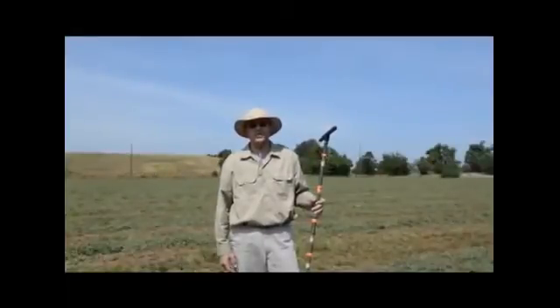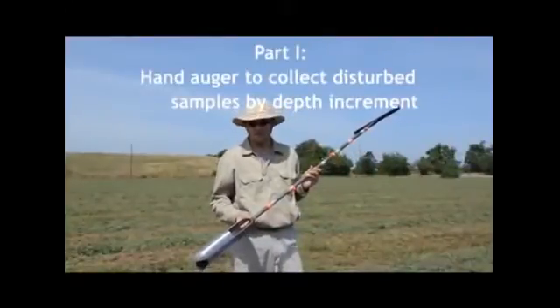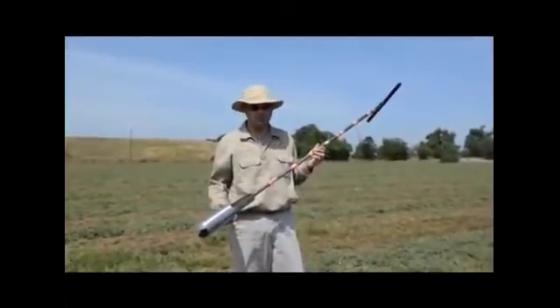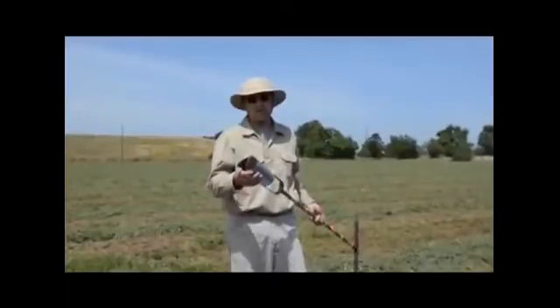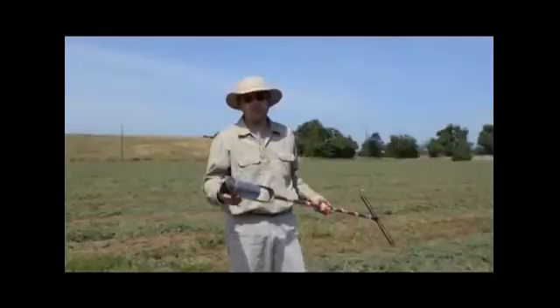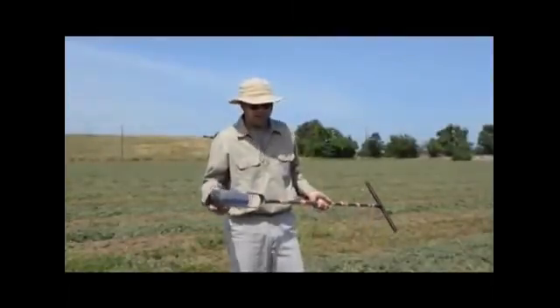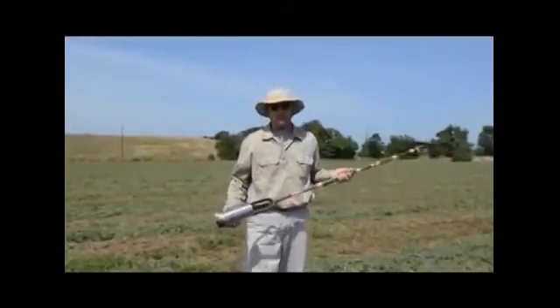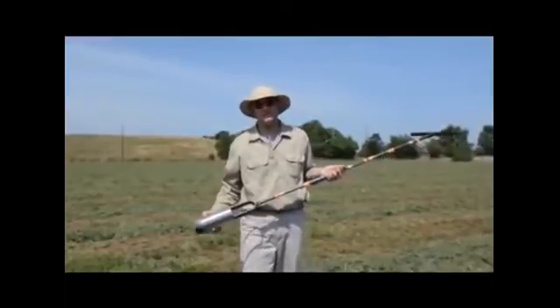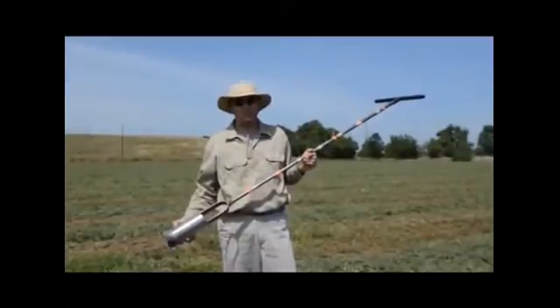such as soil texture. And this is a stainless steel 3-inch diameter closed bucket auger with a 4-foot extension. And the bucket head has two sharp bits that are designed to drive the auger into the soil and dig a borehole. And we start off by identifying the sampling point, and in our case we are not interested in sampling any organic layer, and we want to collect mineral soil samples.